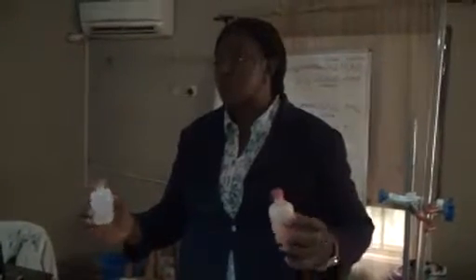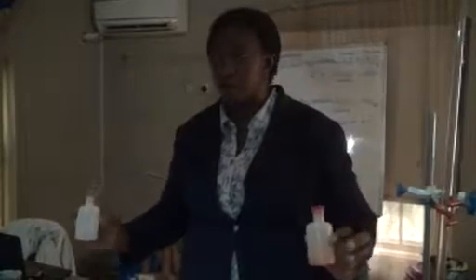Today we are going to be running a titration, and our acid for today is a strong acid labeled A and a strong base labeled B. For a strong acid and strong base titration, you can use any of the indicators, your methyl orange or your phenolphthalein, because a strong acid and strong base takes any indicator. Any indicator is suitable for it. So we're going to be using any one of them.